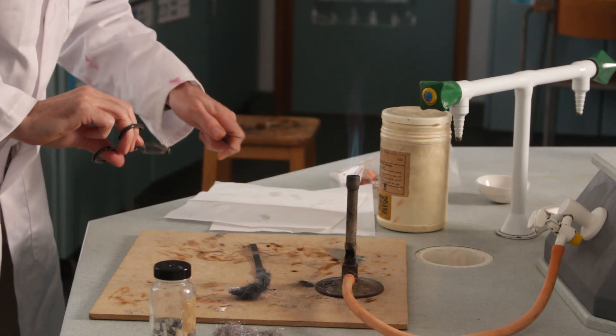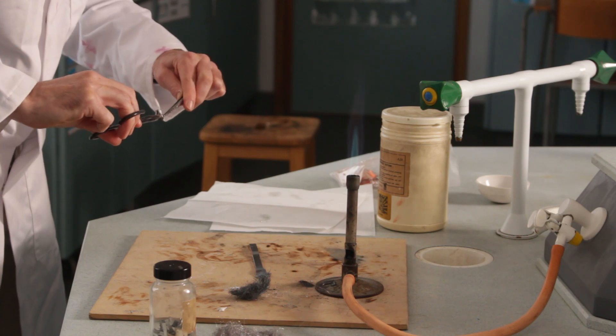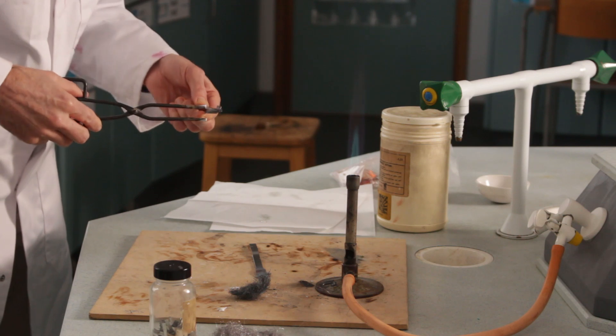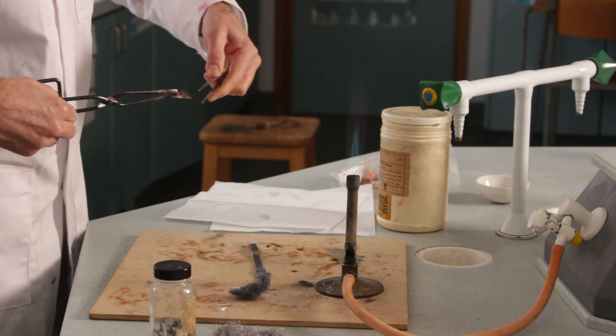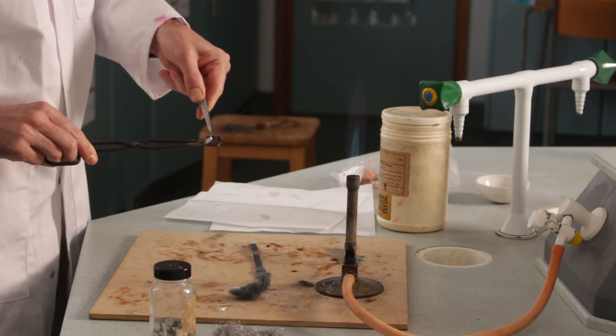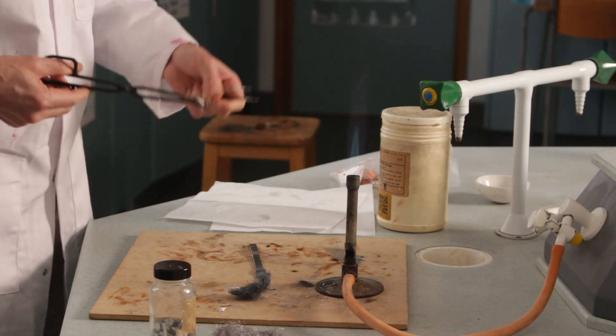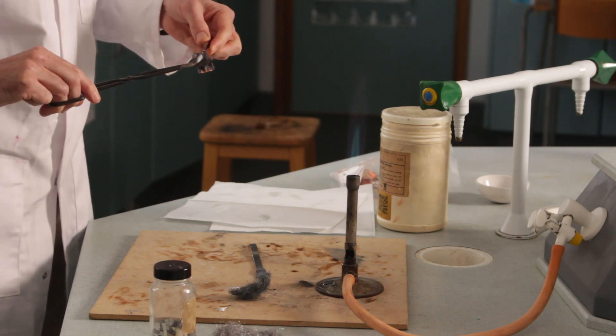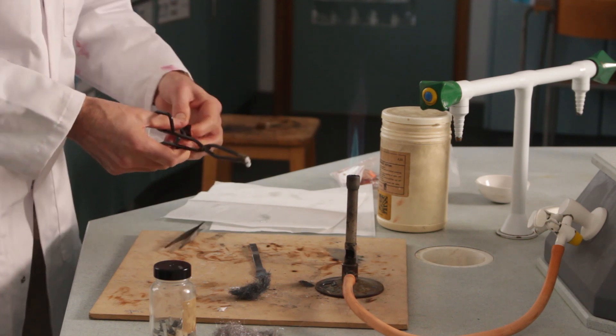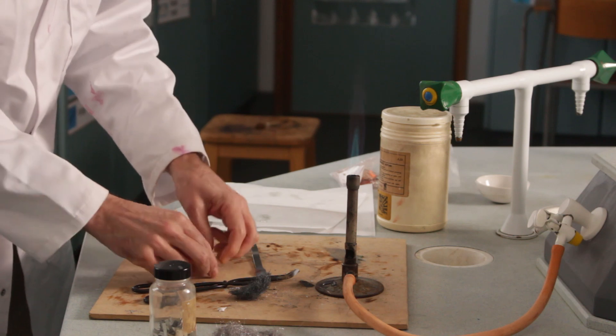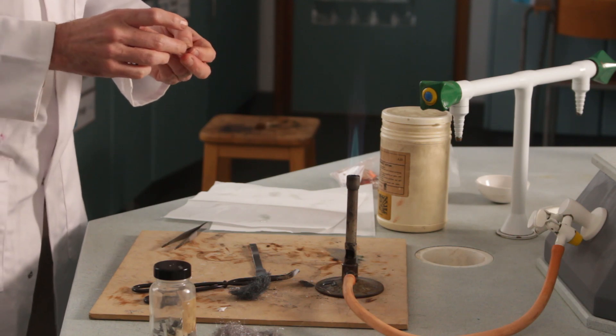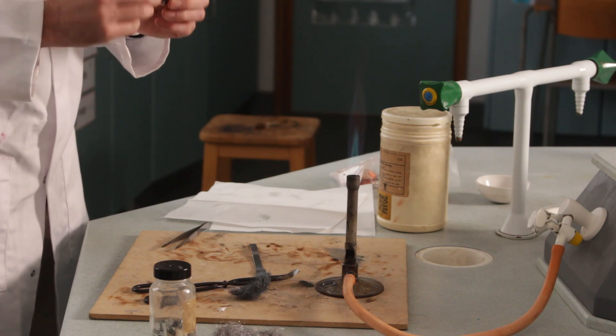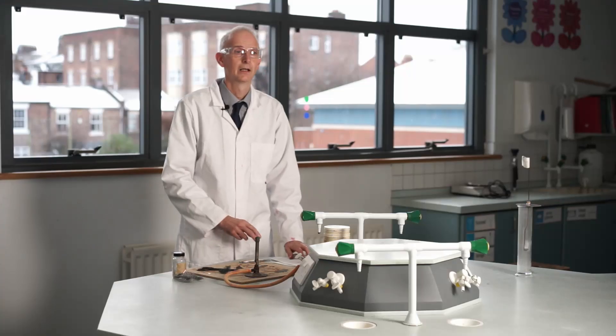How hot is it? Oh, it's still quite hot. So open it up. As I unfold it you start to see the copper color again, and the reason that's still the normal color of copper is of course that it hasn't had any air nearby when it was getting hot. I think that's as far as I can get it. It's still orangey colored inside where it's black on the outside where the air was. We're done.